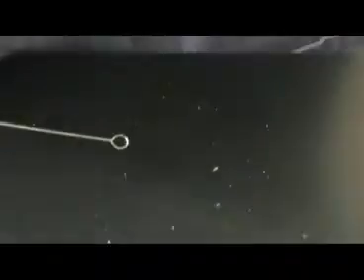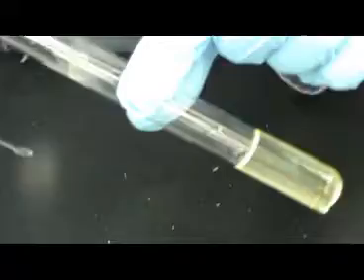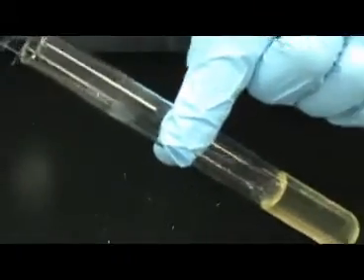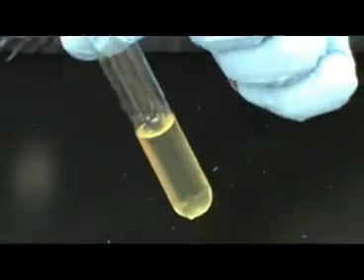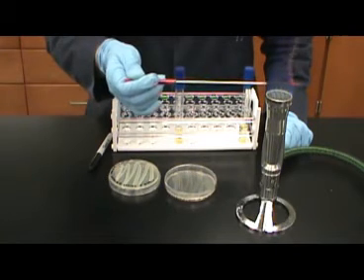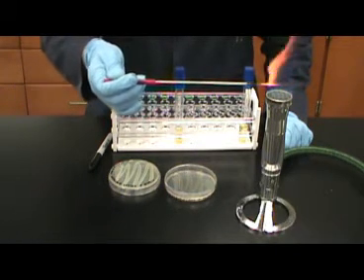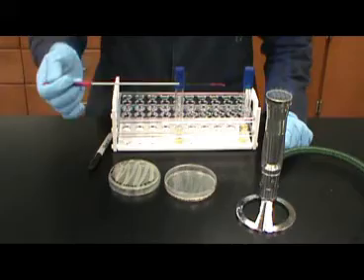Using aseptic technique, gather a large amount of bacteria on the end of your loop. As you can see here, the bacteria is actually visible on the loop. Then stab the gelatin agar with the loop. Be sure to sterilize your loop in between each inoculation.